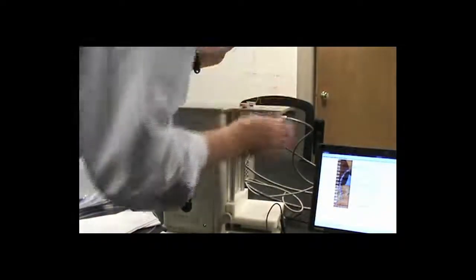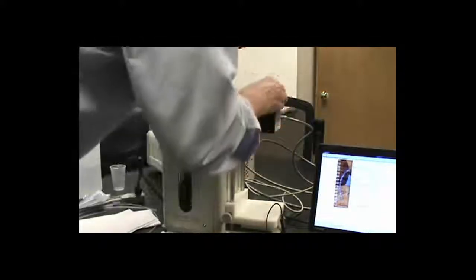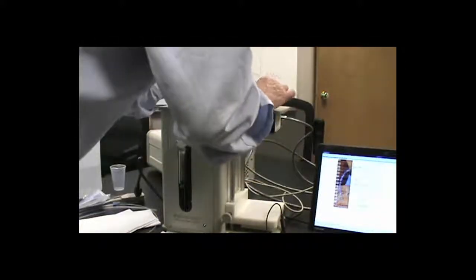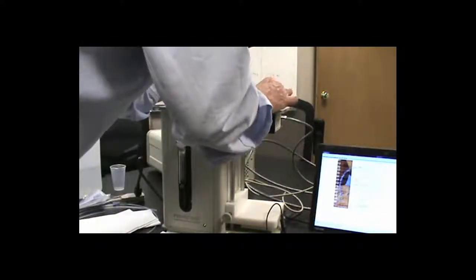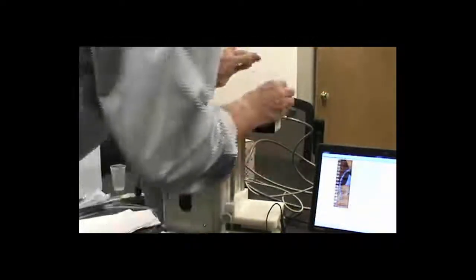After I feed it through the bottom of the sensor, I'm going to pull that through and we'll go back and forth to wet and clean the sensor.